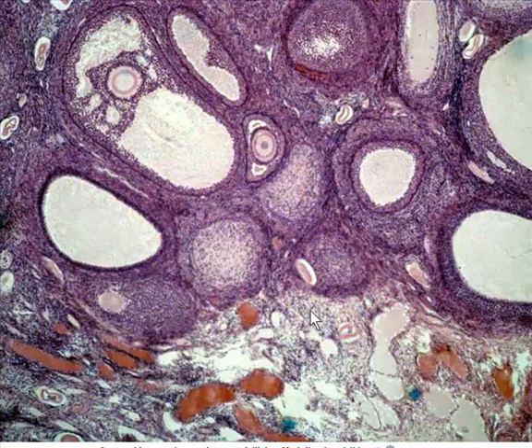This is another one showing medulla down at the bottom. Bunch of follicles out here. Again, here are two secondary because they both have the fluid-filled antrum. This is much smaller. So of the two, we would call this one a mature follicle and this one just a secondary. We can see some atretic follicles again over there.